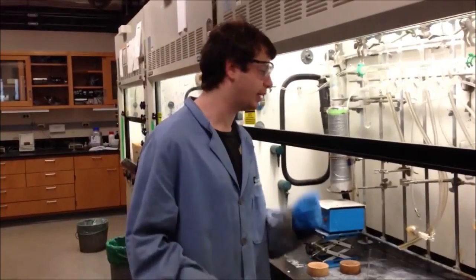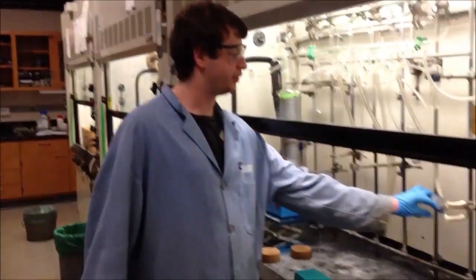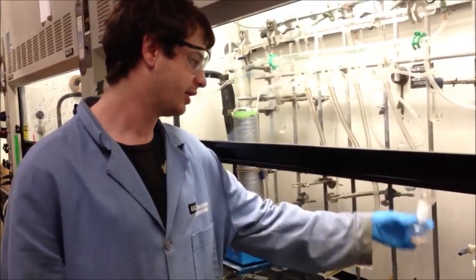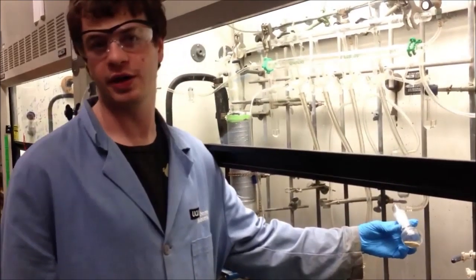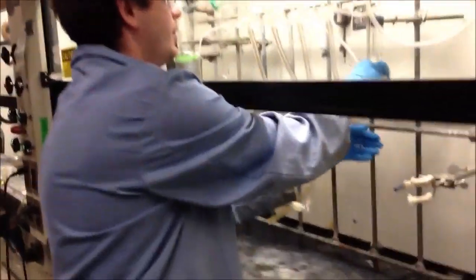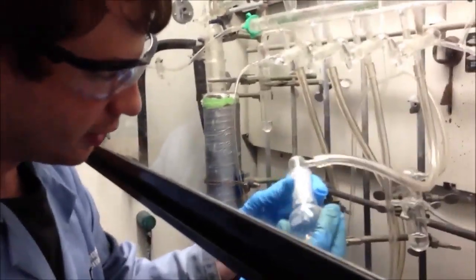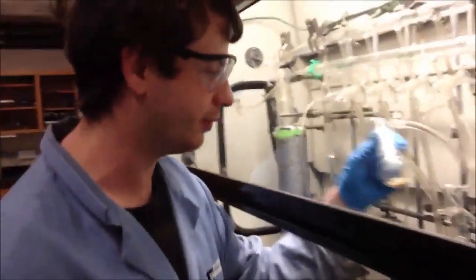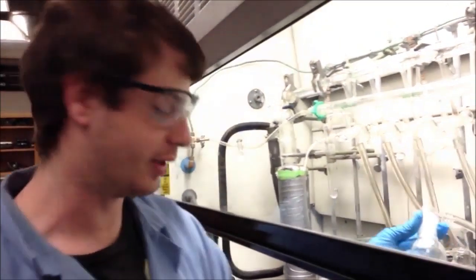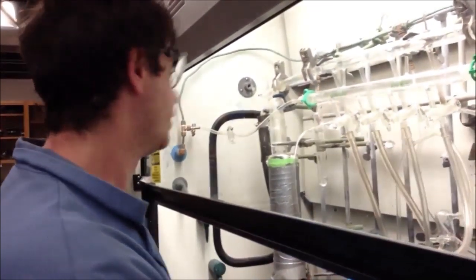Okay, well, we didn't get as much as we wanted. But the question that's more important is, well, we don't really care how much of this we have as long as we have some. The question then becomes, well, did we really make the right thing? And that is often a huge aspect of chemistry is deciding whether you have the compound you want. And then if you do, how pure is it? So I'm going to bring it out here and I'm going to show you how to prepare a sample for analysis. So I had made this compound before and when I made it before, it was a lighter color. But this looks darker, which might be an indication that we have an impurity in there. But there's only really one way to say for sure.